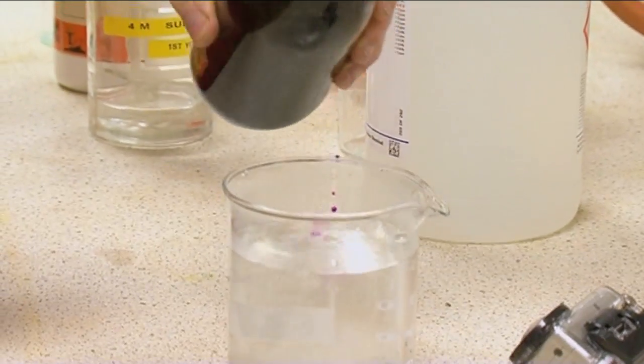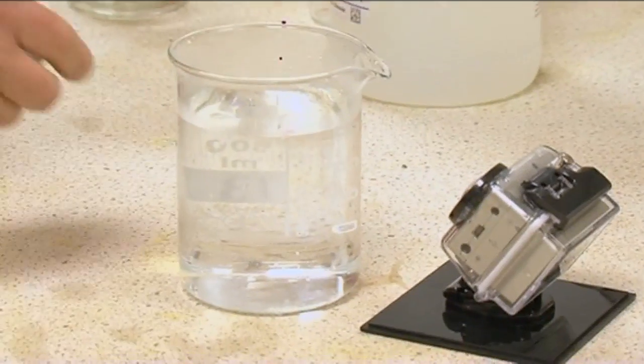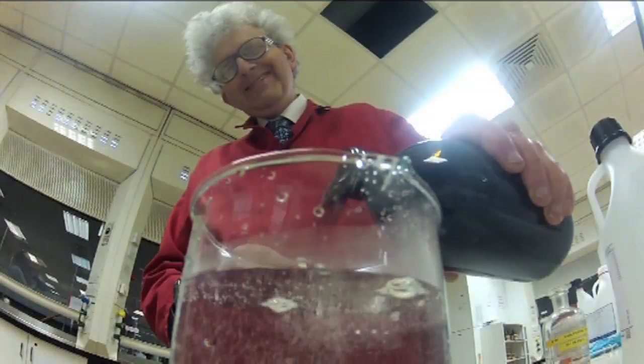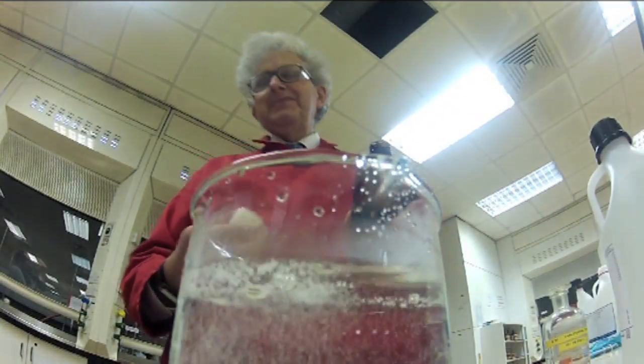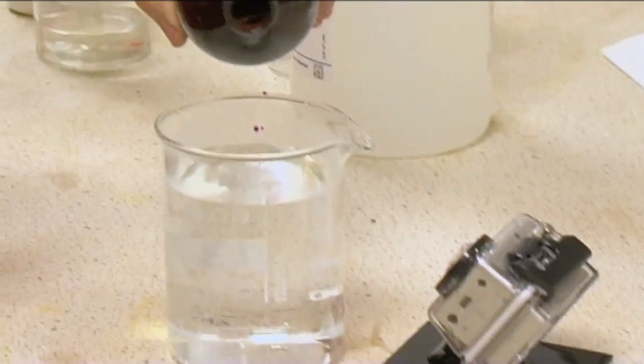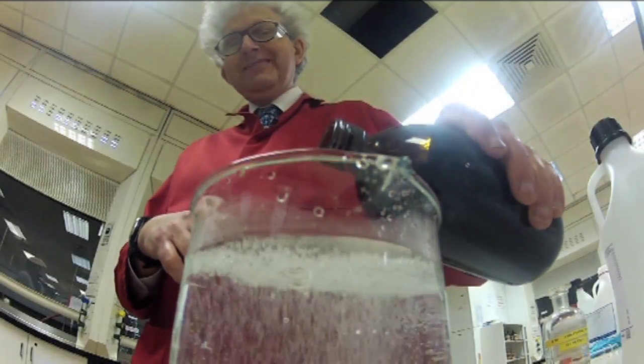What's going on there? So what's happened now, I didn't wash the thing out properly and we had some peroxide left. And now it's reacting faster than we can add the permanganate. So this is actually much better than I intended because I was going to make it purple and make it go clear. And here you can see I'm pouring in the purple solution and it's disappearing. That's brilliant.